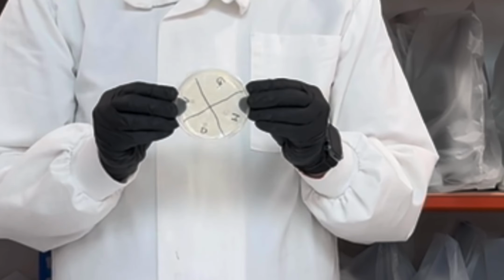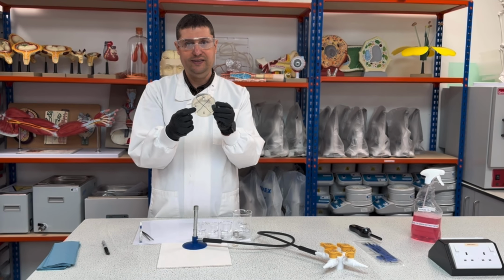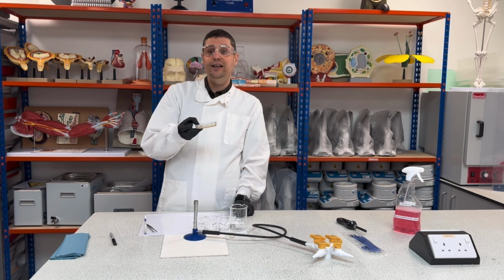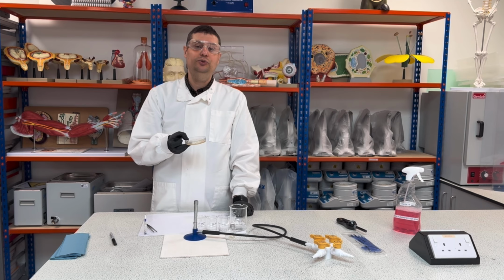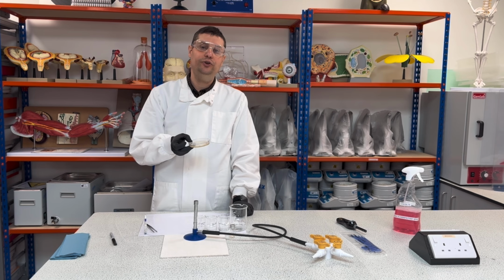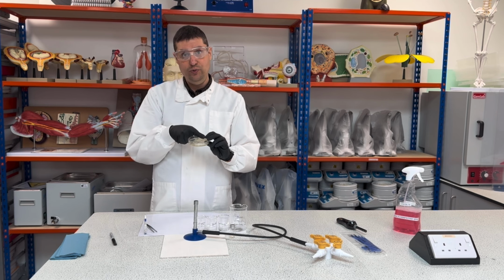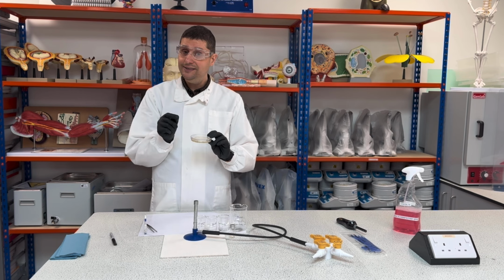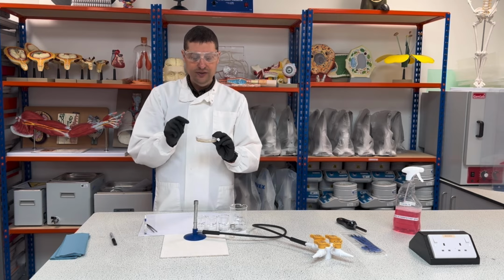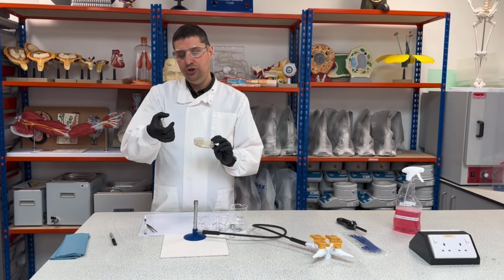So this is how you see, okay? You have your 3, 4 discs here, and then this will go to the oven. In the oven, we will keep about 25 to 29 degrees, for at least 24 hours. After 24 hours, the bacteria should grow everywhere, less the disc of penicillin, and if one of the other 3 substances have antibiotic effects, you're gonna see a ring around, okay?